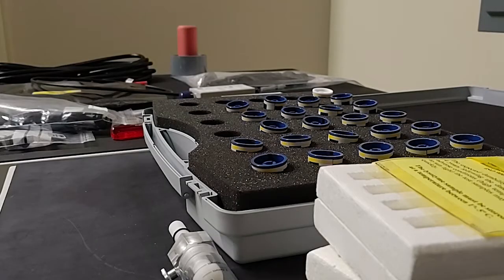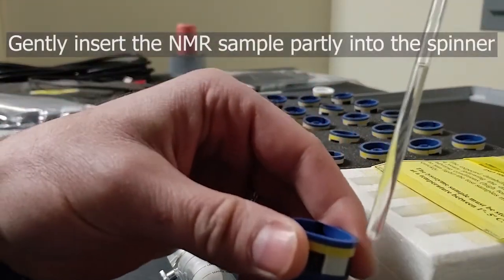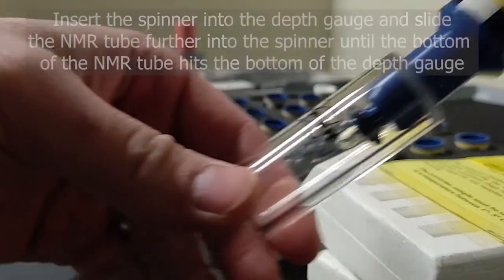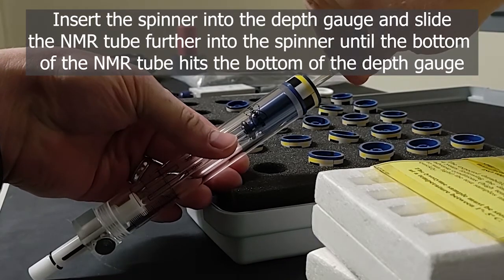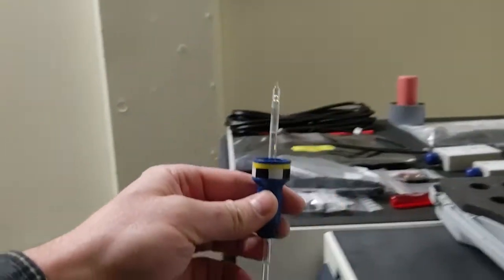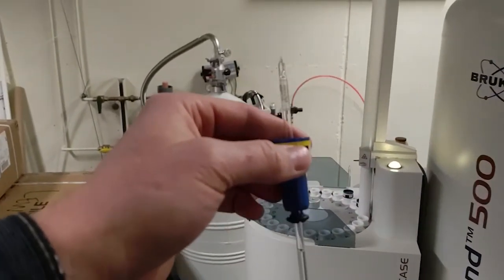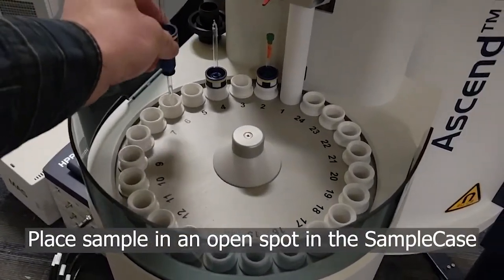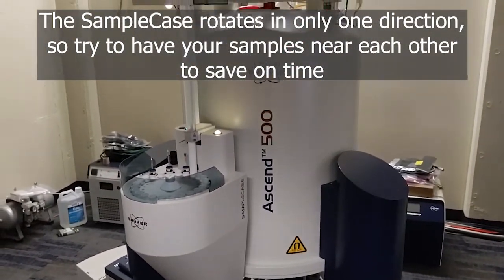To place your sample in the spinner, you can take the spinner here and you slide your sample slightly into it, and then take it to the depth gauge. You can see that here, and then you simply slide it down until it stops. So you can see that there. And you pull it out, and you can see it sitting in the spinner there. Okay, and then we take this and we put it in our position in our spectrometer. We're going to take position 6, and that'll be how we load it in for now using IconNMR.